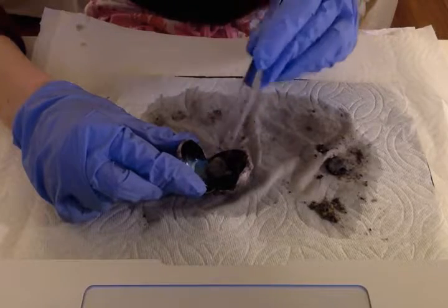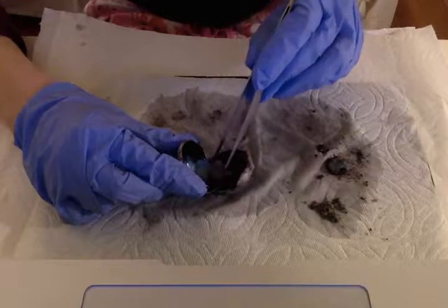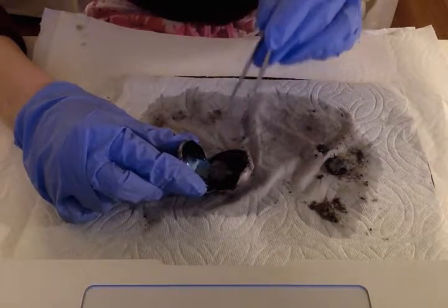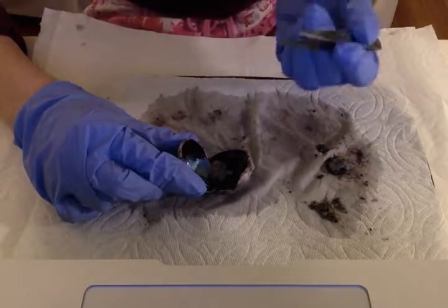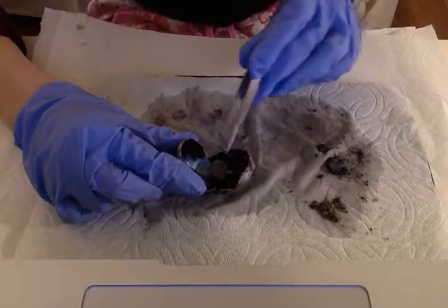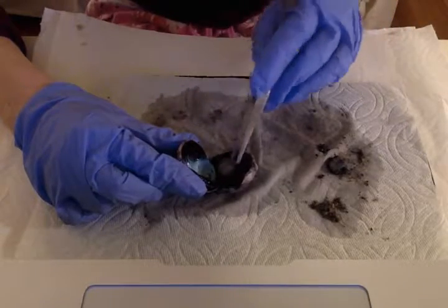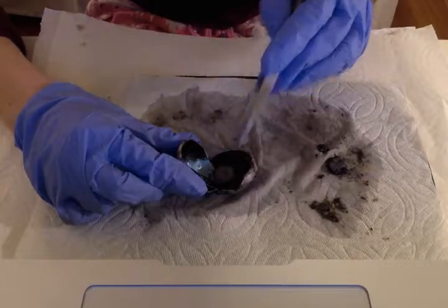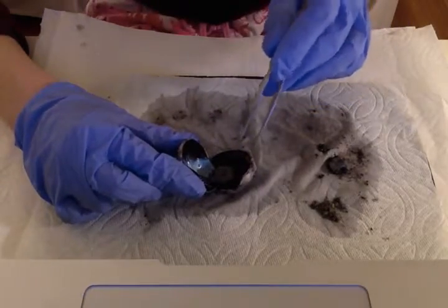And the lens is very thick and firm. I kind of think of it as like a nut, and I was very surprised by that. I thought it was a very thin piece of, well, almost like plastic. So that was interesting. And you can see it's this creamy, very light brown color. I believe that's probably because the eye has been preserved for a while.